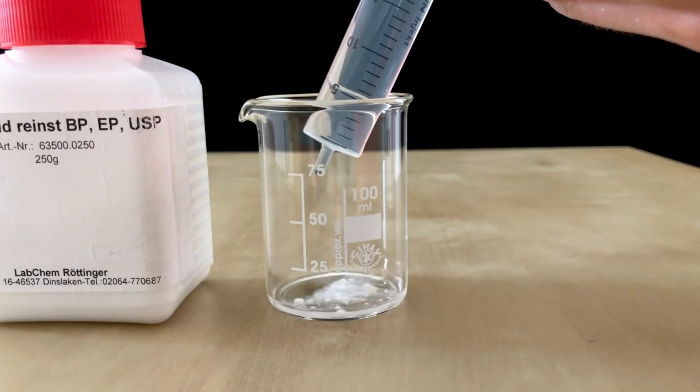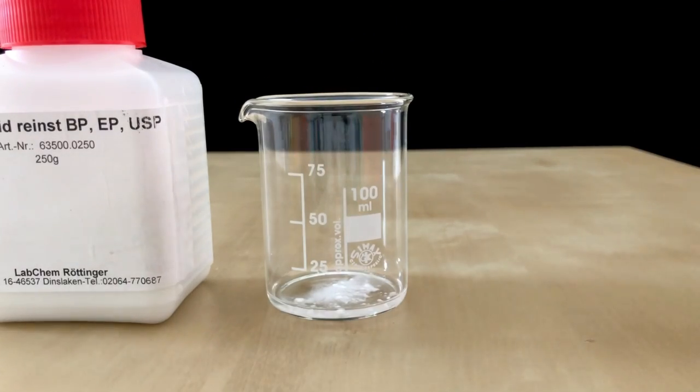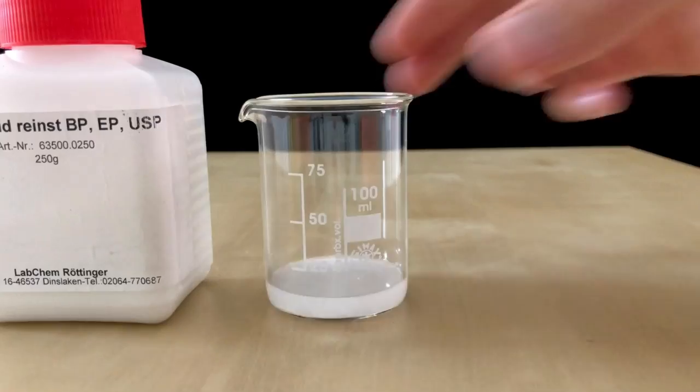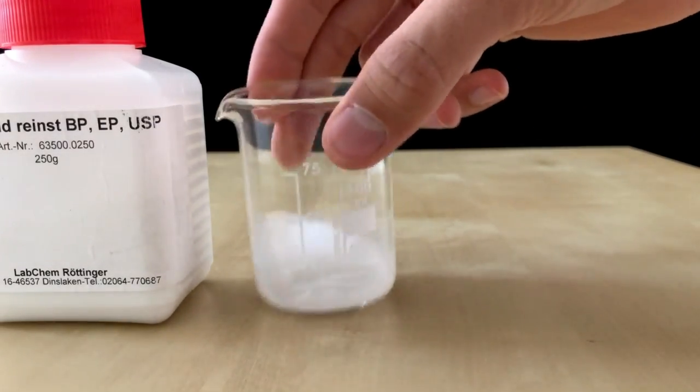I added 2 milliliters of glacial acetic acid but because it didn't dissolve I added about 15 milliliters of water. It also didn't dissolve in the water-glacial acetic acid mixture but this doesn't matter.